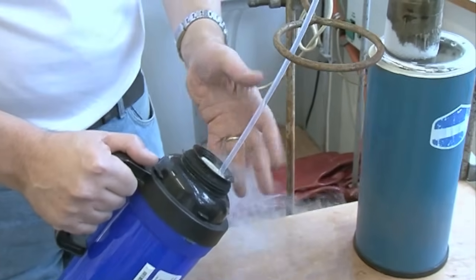But I suppose it's like oxygen or nitrogen. You can't really see it. But perhaps if we condense it as a liquid, then I'll see it properly. Okay, so I'm now going to cool this down with liquid nitrogen to minus 196. I'm going to do it slowly. It will take a little while.